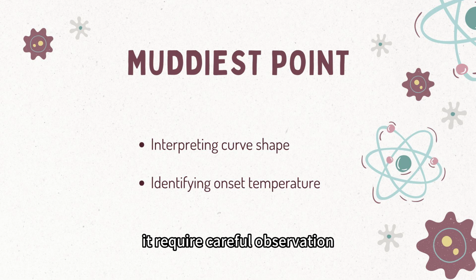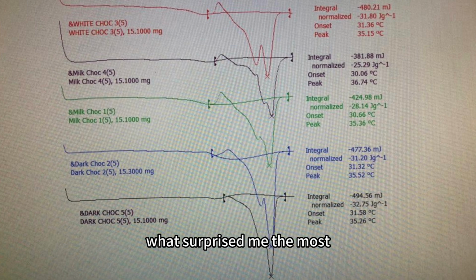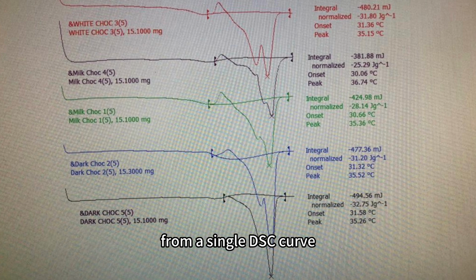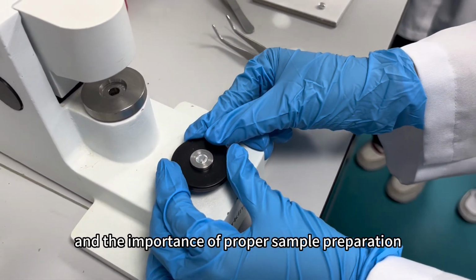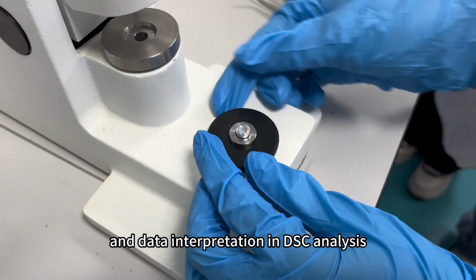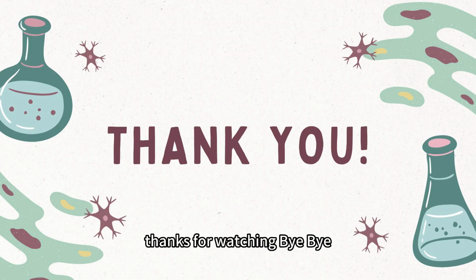It required careful observation to move beyond simply recognizing the peak. What surprised me the most was how much information could be obtained from a single DSC curve, even with a very small sample size. Overall, this practical helped me understand the thermal behavior of chocolate and the importance of proper sample preparation and data interpretation in DSC analysis.